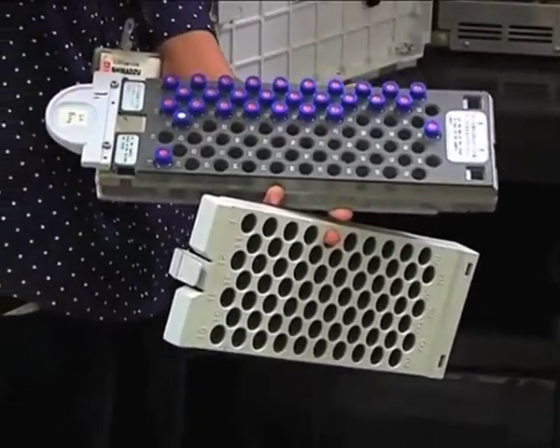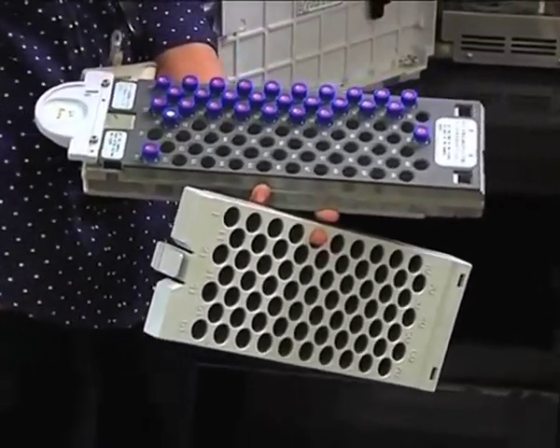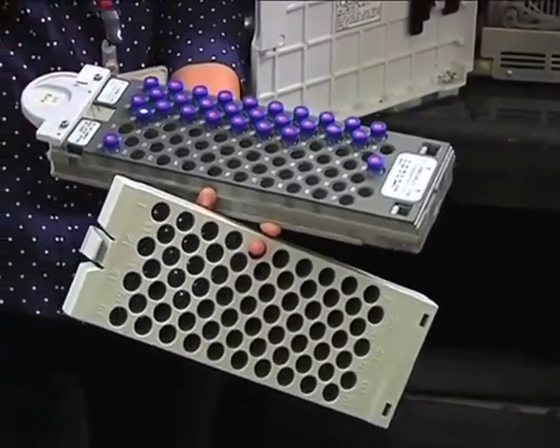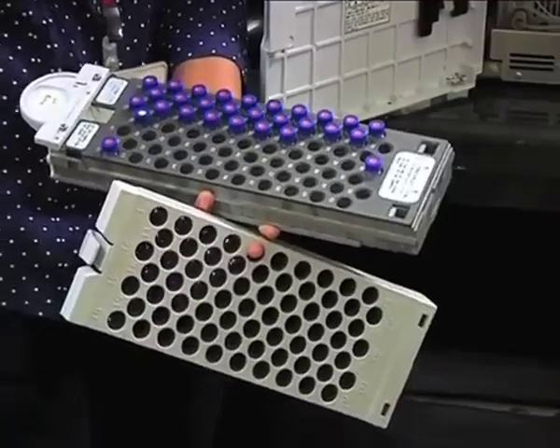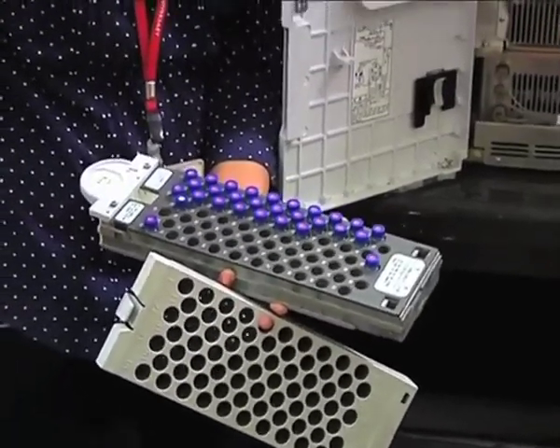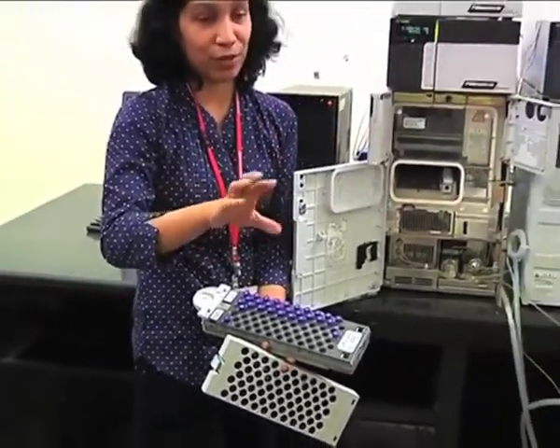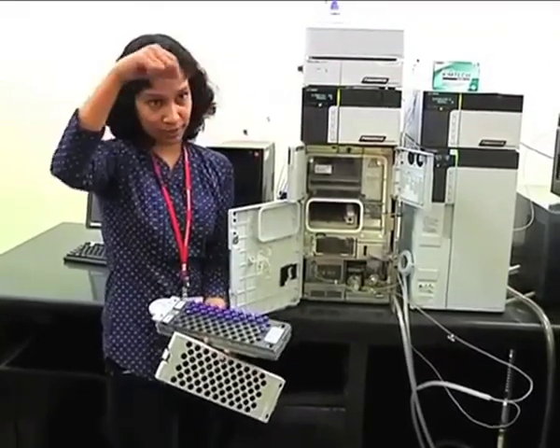Now if the needle goes to the injector port and injects the sample, there is a possibility that whatever is stuck to its outer surface will get deposited on the injector port, and when you perform the next analysis, even if you are not injecting sample, if you are injecting only organic solvent or only water, the traces of those residues will pass and give you a response.